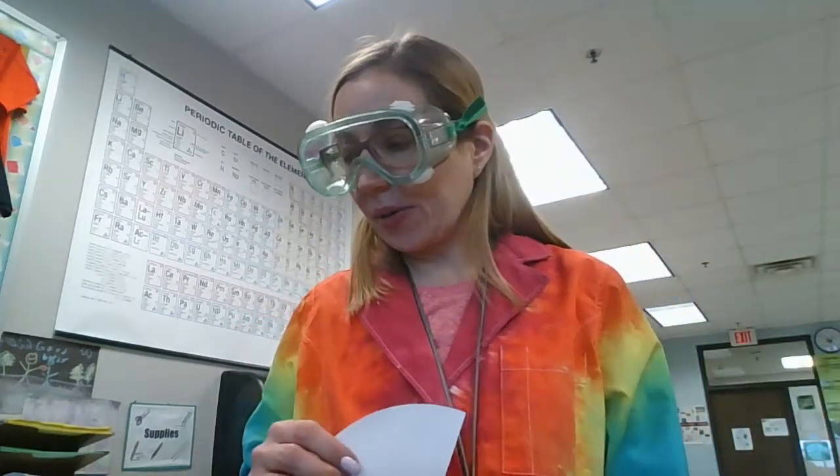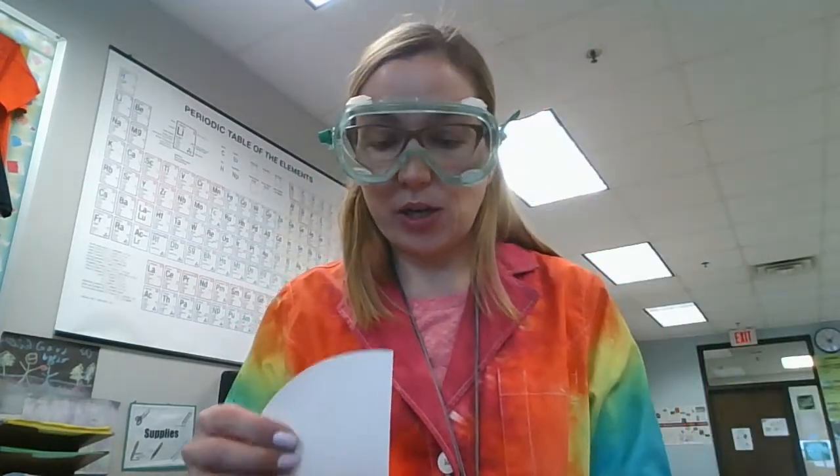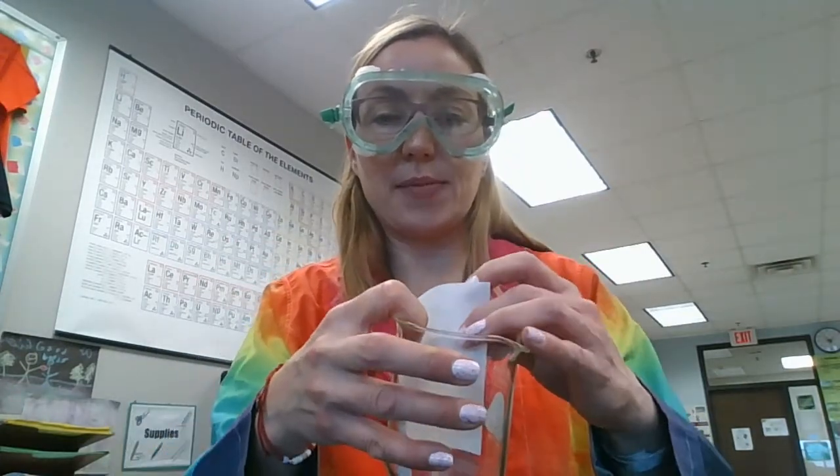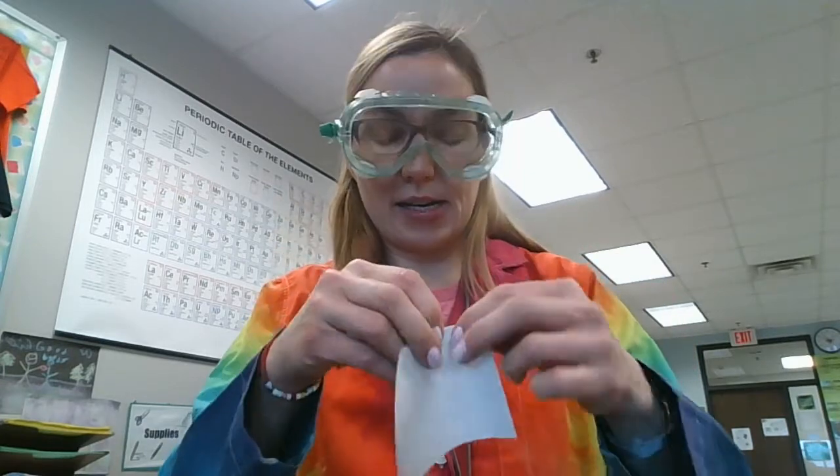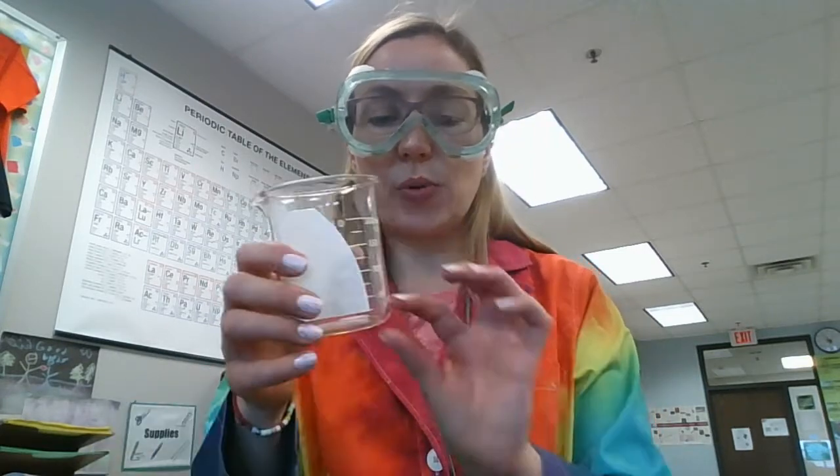The triangle of filter paper is going to go in your beaker, so you're going to get a 250 milliliter beaker and you're going to just have that filter paper ready to go for your lab day. It sticks out a little bit so you have to fold some down and then you put that along the inside of your beaker.